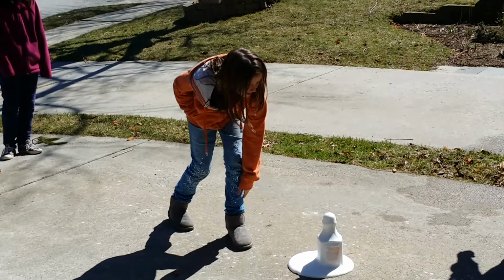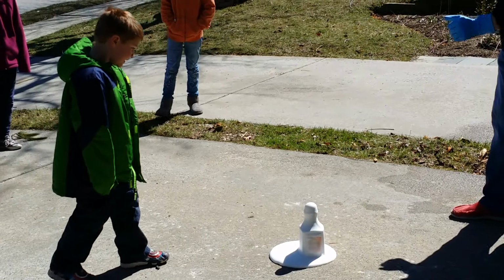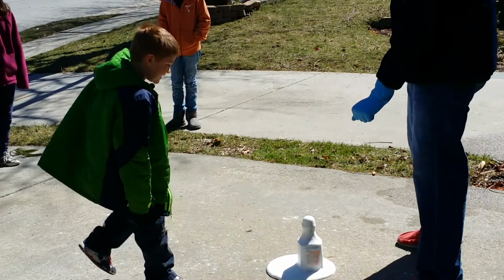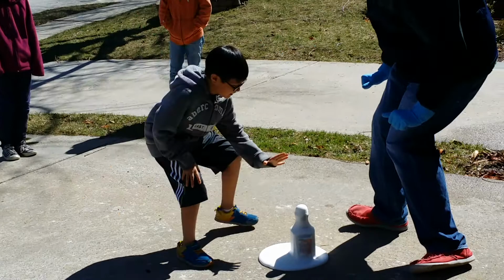Not quite like a campfire, but that's a little bit cool. Andy, do not touch the foam. That's the most important thing. You can come close where Chloe was. Stick your hand up there quickly now. Andy, don't touch the foam. You close enough, buddy. Feel how it's a little bit warmer? Yeah. All right. Yep. Real quick. Do not touch the foam.